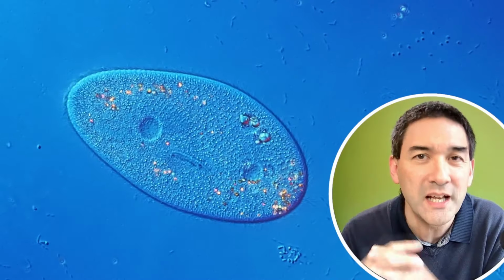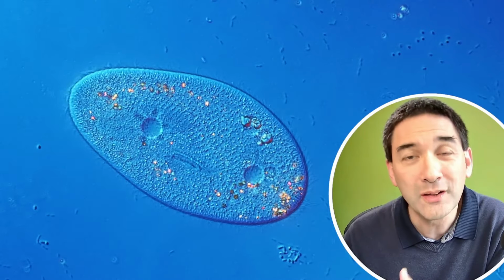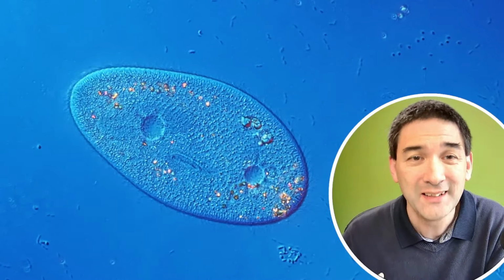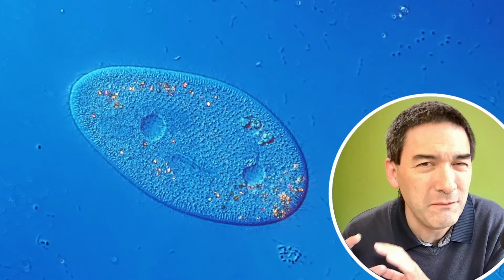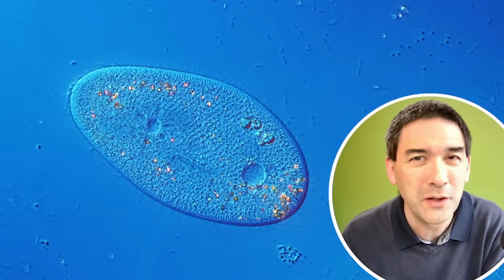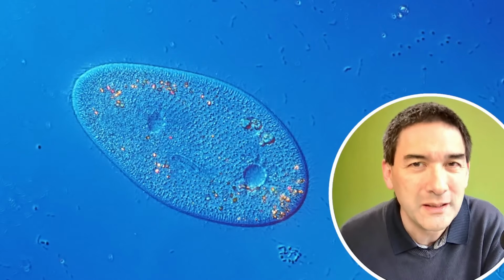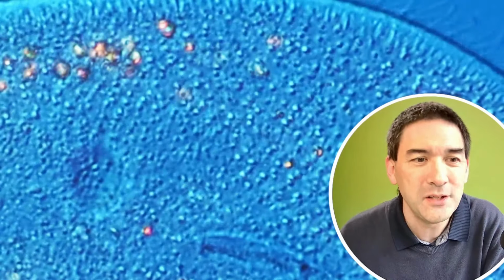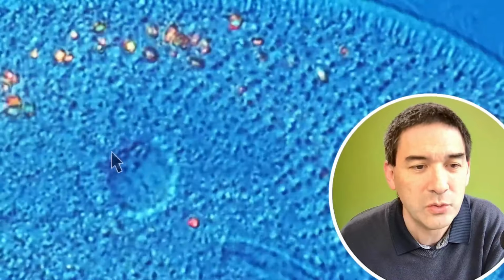They're changing their size, and as a matter of fact, they work like pumps that pump the water out of the cell again. And later on, I'm going to show you in phase contrast a very large magnified contractile vacuole, how it's actually working in action. I think it's quite nice to see. But let's zoom in a little bit more here. And this here, again on the side, this is the contractile vacuole over here.